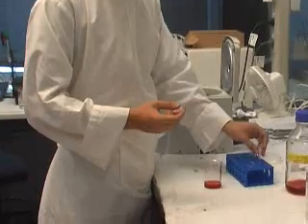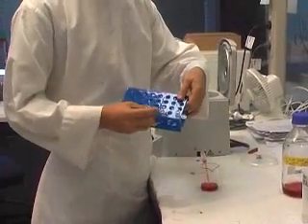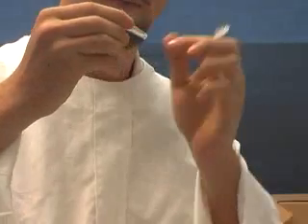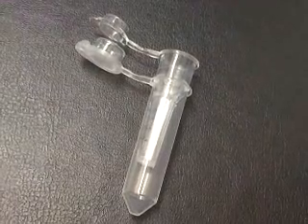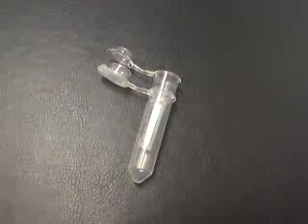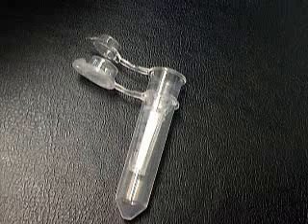Jason is using ultrafiltration to determine the size of the gold nanoparticles. Inside each tube is a membrane; the first one is a 10,000 daltons cut-off. Anything above this size will be retained in the upper chamber, and anything below this size will pass through the membrane and be collected in the lower chamber.